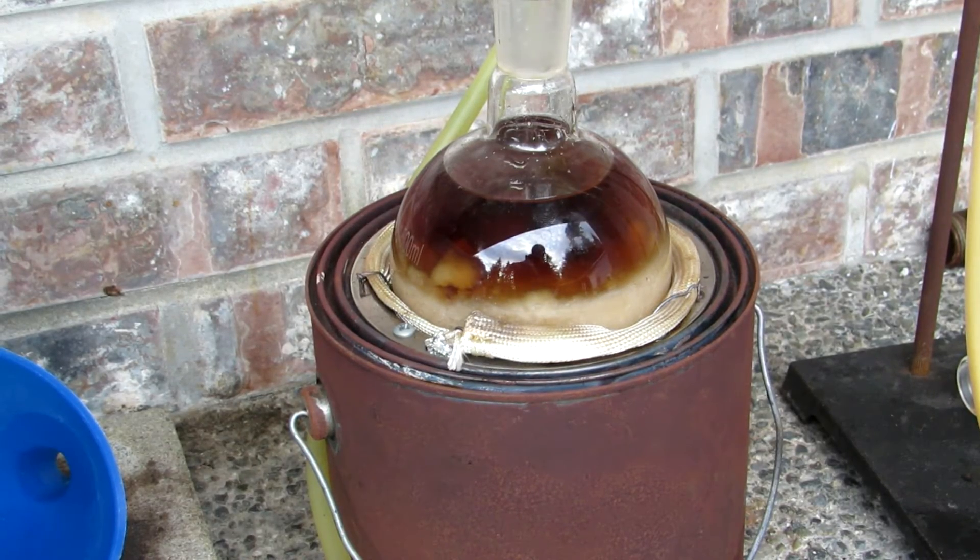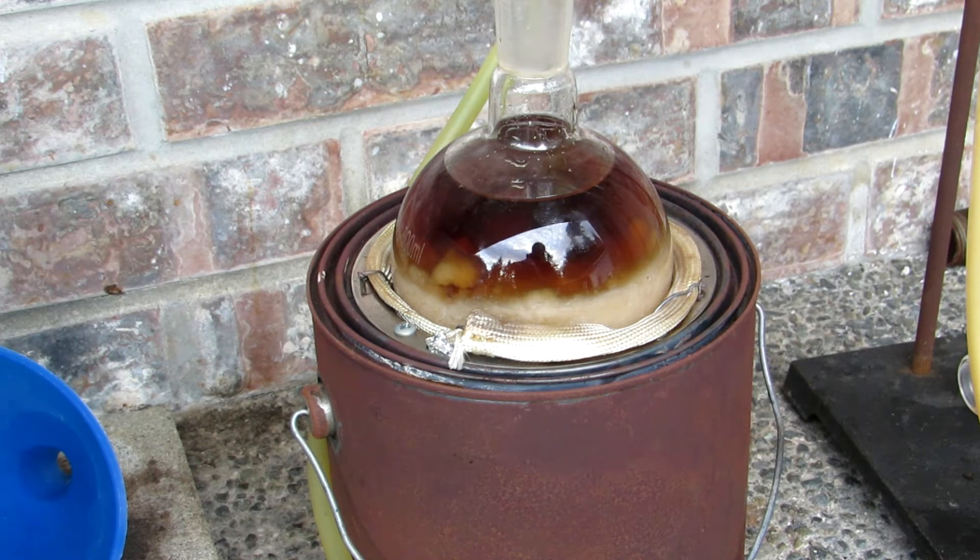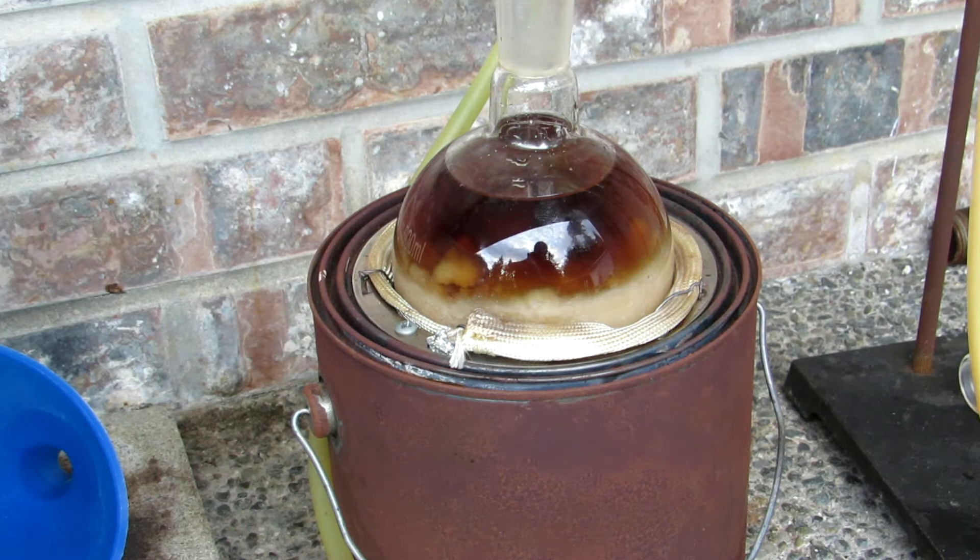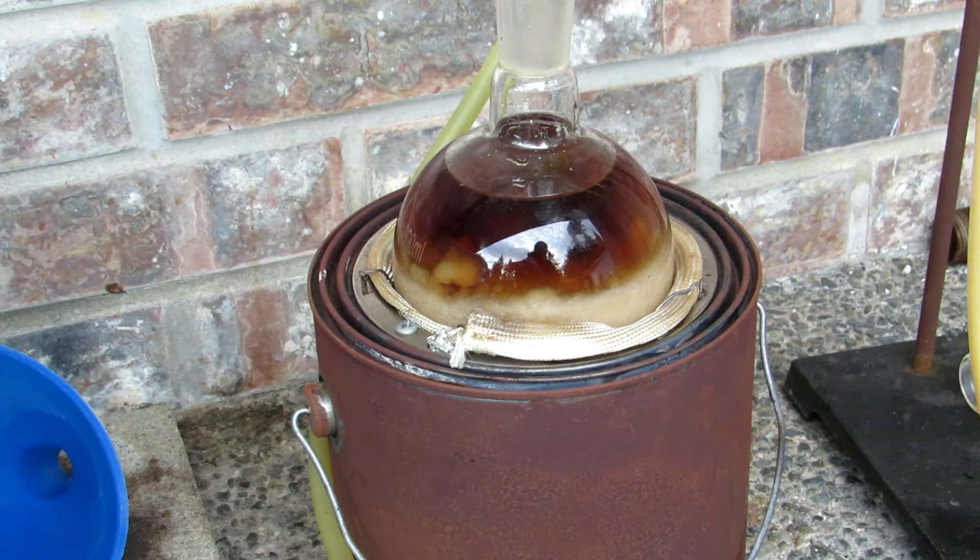Initially, everything was added into a 500 milliliter round bottom flask, however, as you can see, it clearly didn't fit. So, before beginning the distillation, I quickly swapped it for a 1 liter flask, and this worked much better.